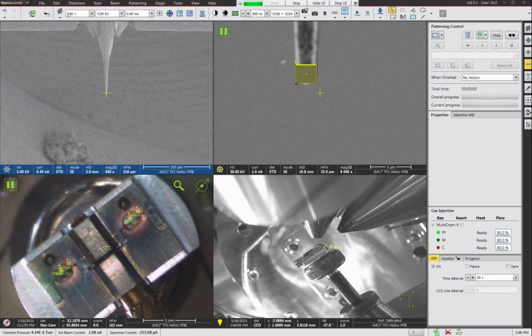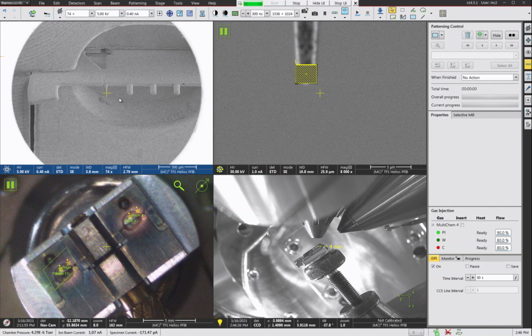And just keep in mind, you'll have just a little bit of an angle on that top, but I've never found that that causes any real problems. It looks a little odd when you're looking at the side view of the weld because the top's not flat, but it should work out okay. Be careful once you take these out of the system. It's really easy to bend these posts because they really don't have any mechanical support. They will be protected a little bit from the wing on the side here and this neighboring post, but try to be careful with these, especially once they're sharpened into an Atom Probe tip.